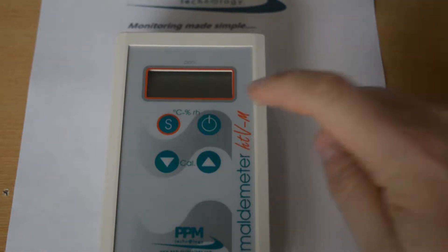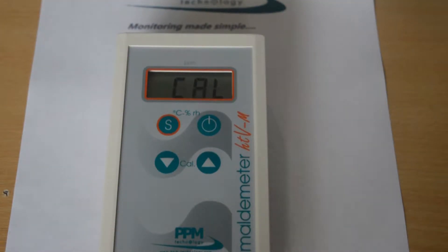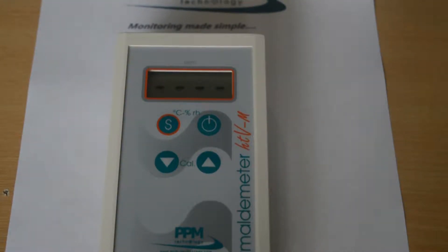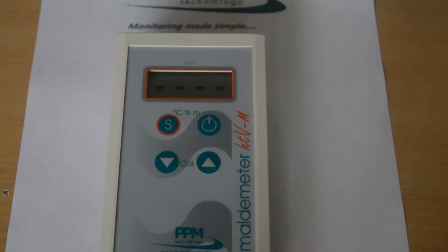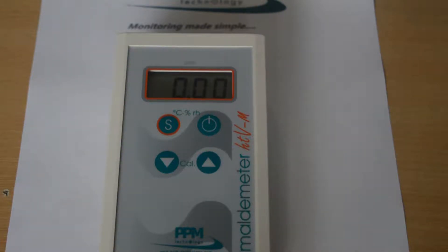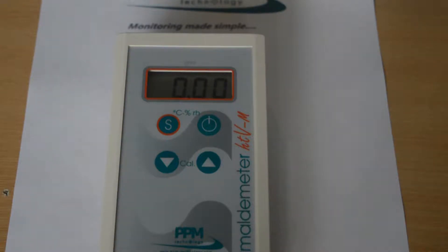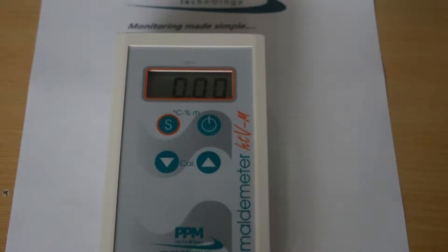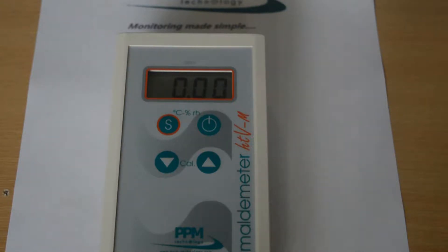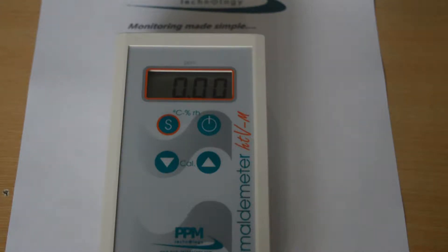You will notice 4 dashes will appear for around 3 seconds as the instrument checks the sensor background. Once this is done, the instrument will display 0.00, showing that it is ready to take a sample.